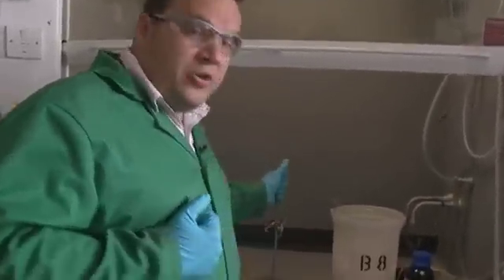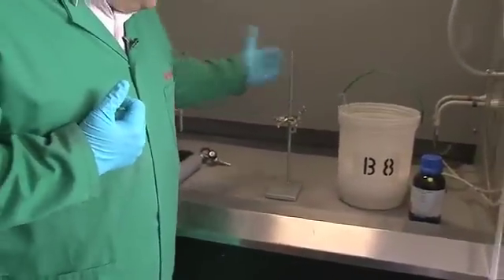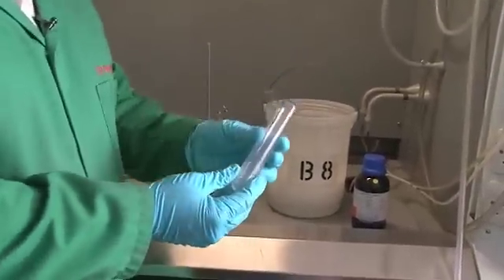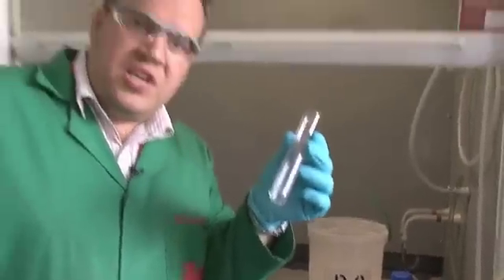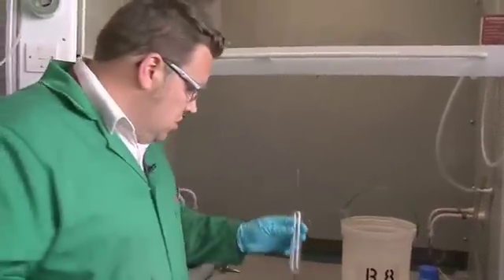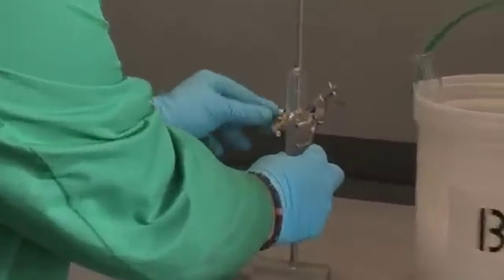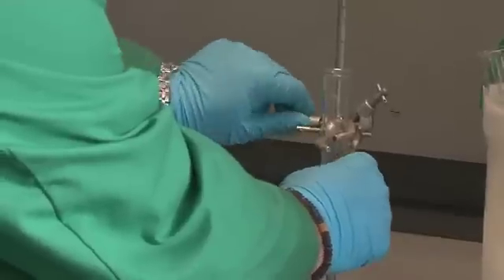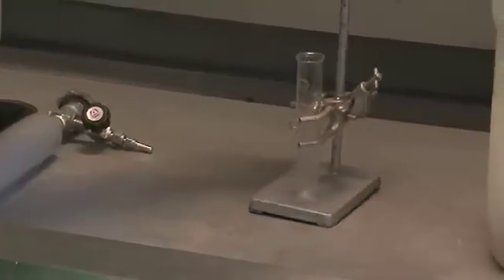So in the fume hood, we've got a small amount of equipment. We have a stand which we're going to use to contain our reaction and we're going to do the reaction in a test tube. What I've done is I've cooled the test tube in ice so it's cold. I'll clamp it up and lower it so that it's steady — you can see it quite nicely.